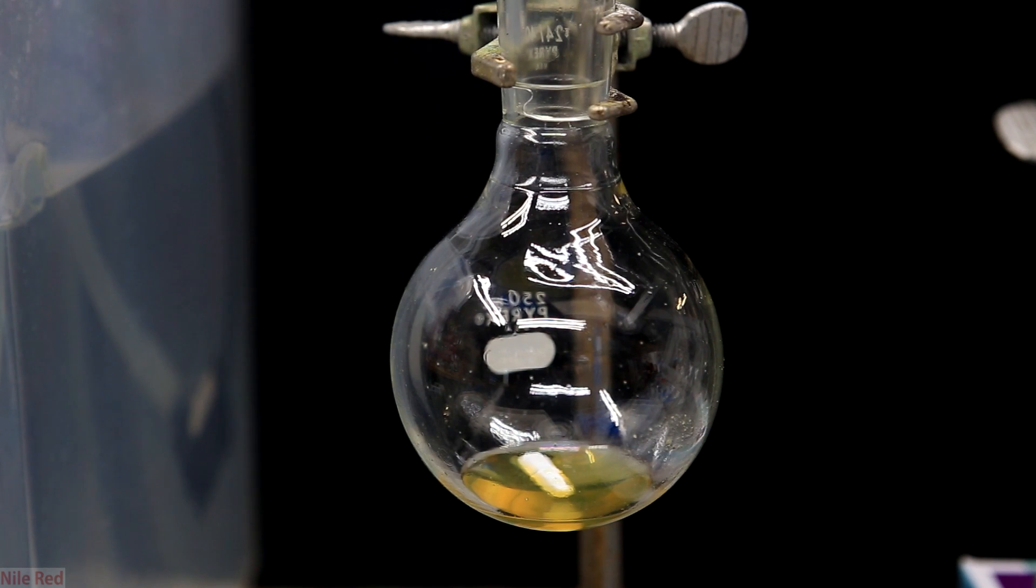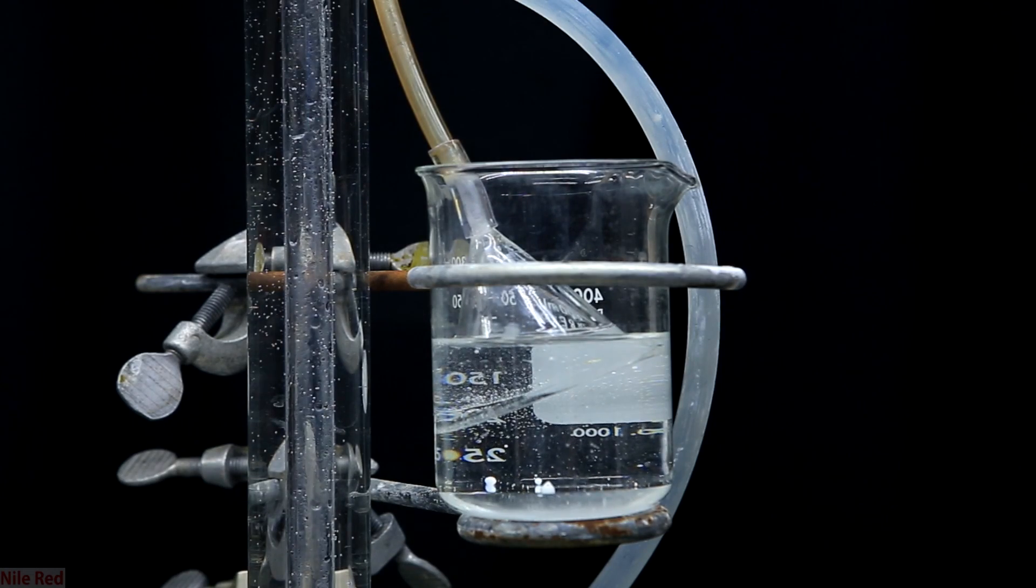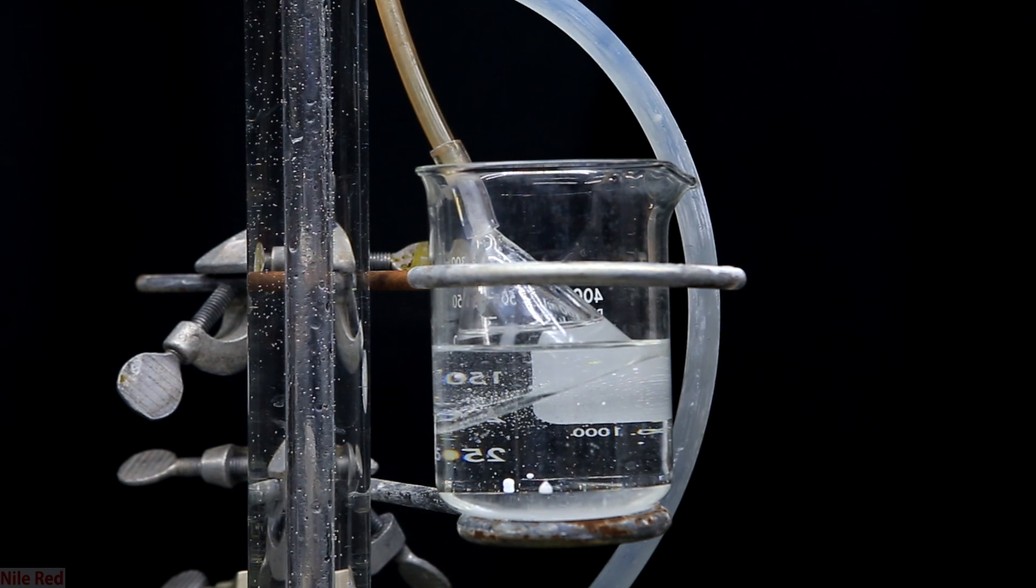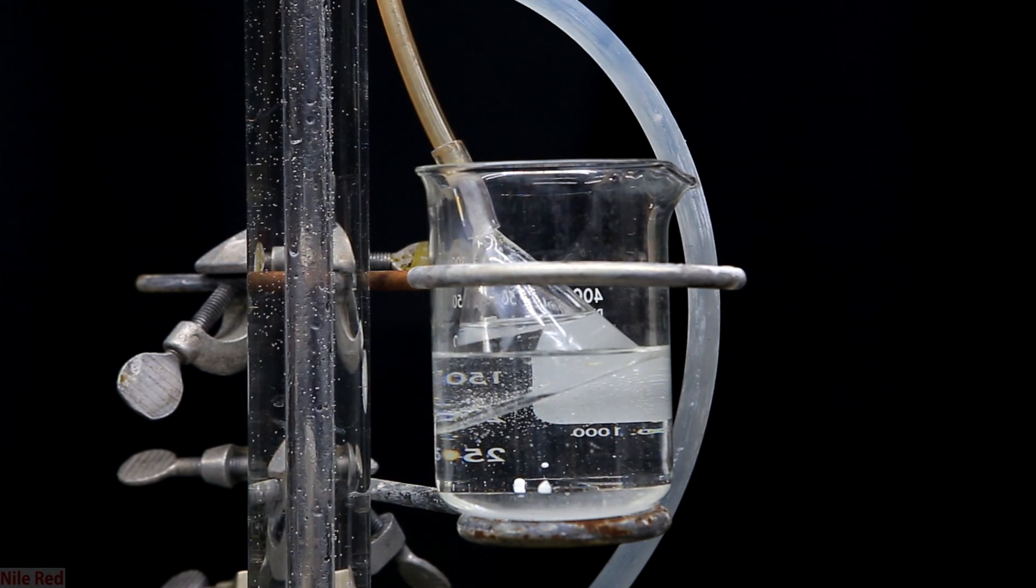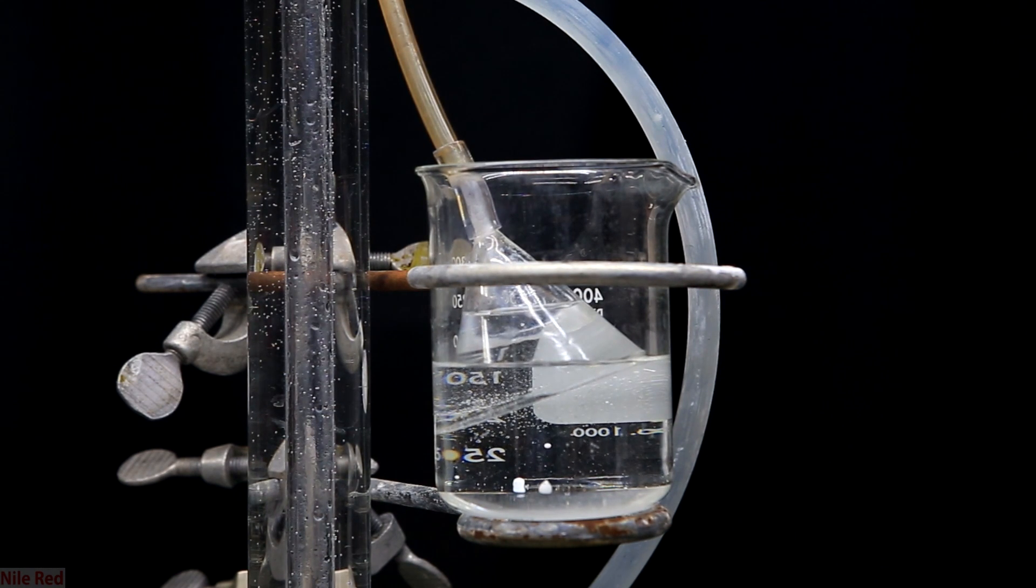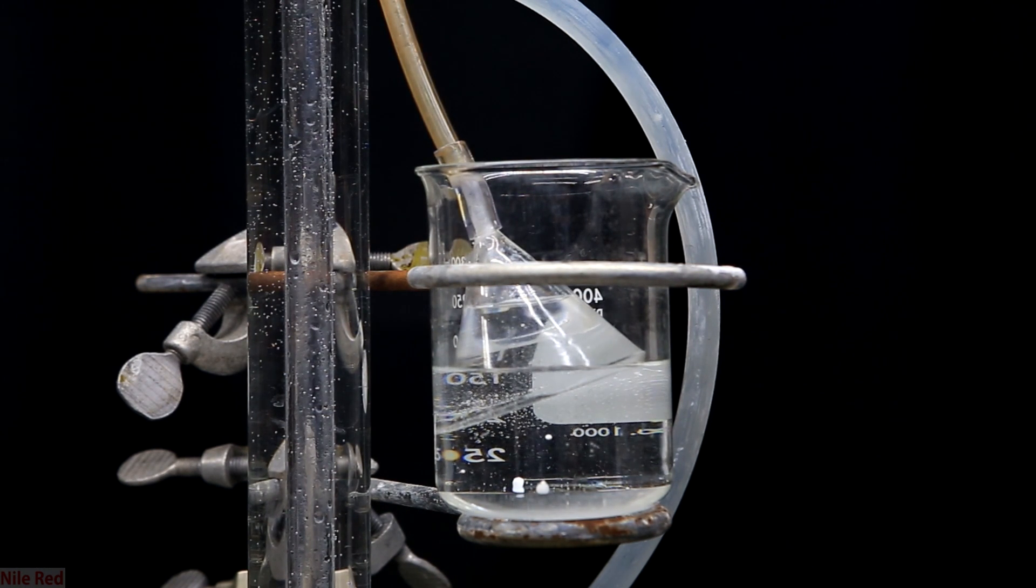The point in mentioning this is to be very careful because it's a strong irritant. When I worked with it I didn't wear any sealed goggles so my eyes were attacked pretty easily. Working with it can be pretty bothersome but the worst is when you clean out the glassware. It can leave your eyes watery and burning for a few hours even if you wash them out, so it's important to be careful.